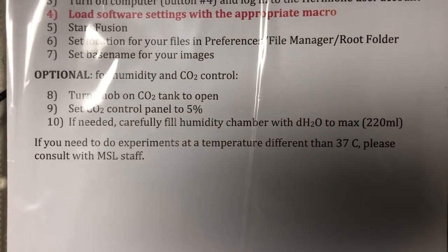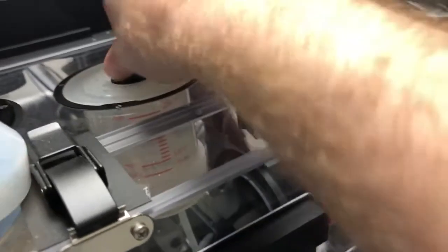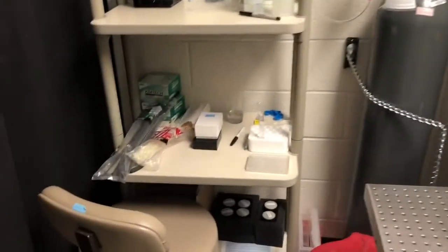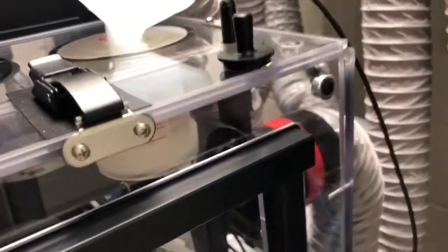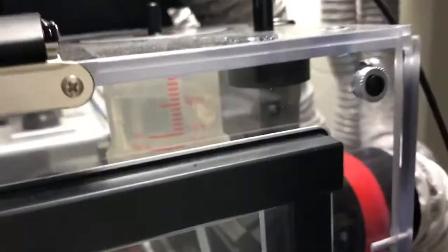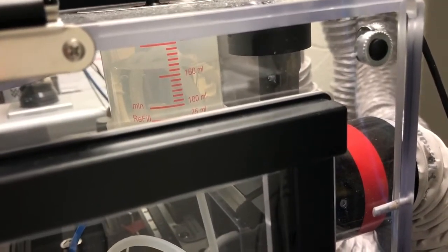Finally, step 10: if needed, carefully fill the humidity chamber with distilled water to the maximum, which is 220 milliliters. That chamber is here, and it can be filled by removing the cap and putting the funnel there — there will be a bottle of water there which you can use to fill it. For reference, this humidity chamber evaporates at a rate of about one milliliter per hour. So if you're only doing a short experiment there might be enough liquid already, but if you need a very long experiment, you want to max it out to 220 milliliters.